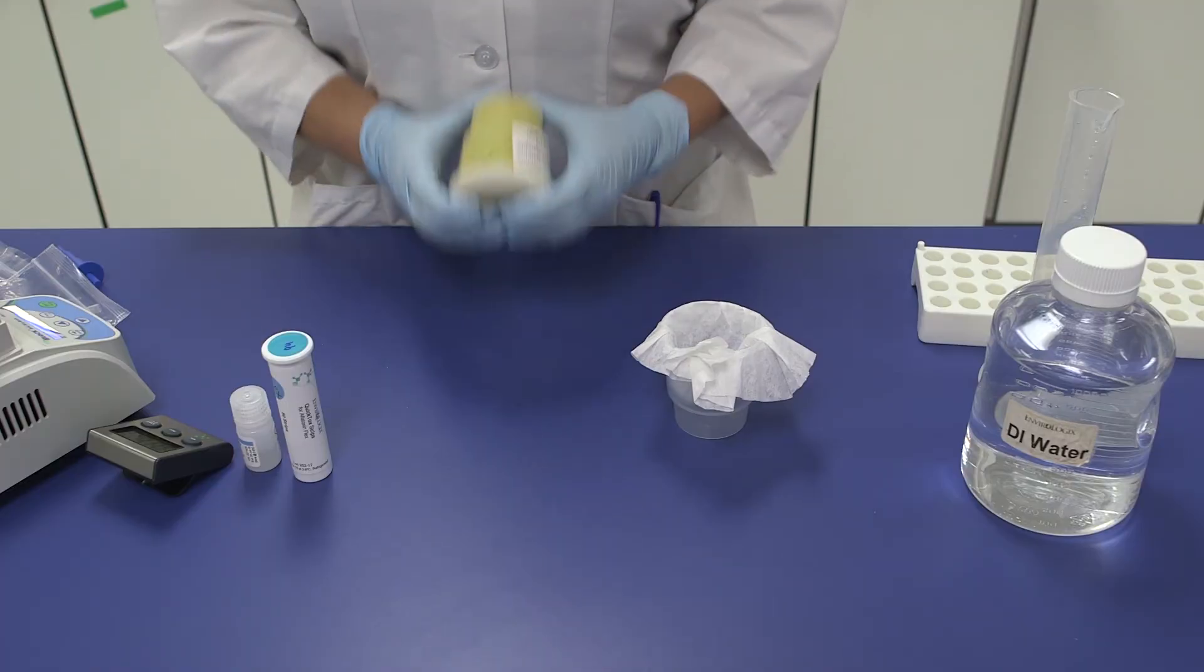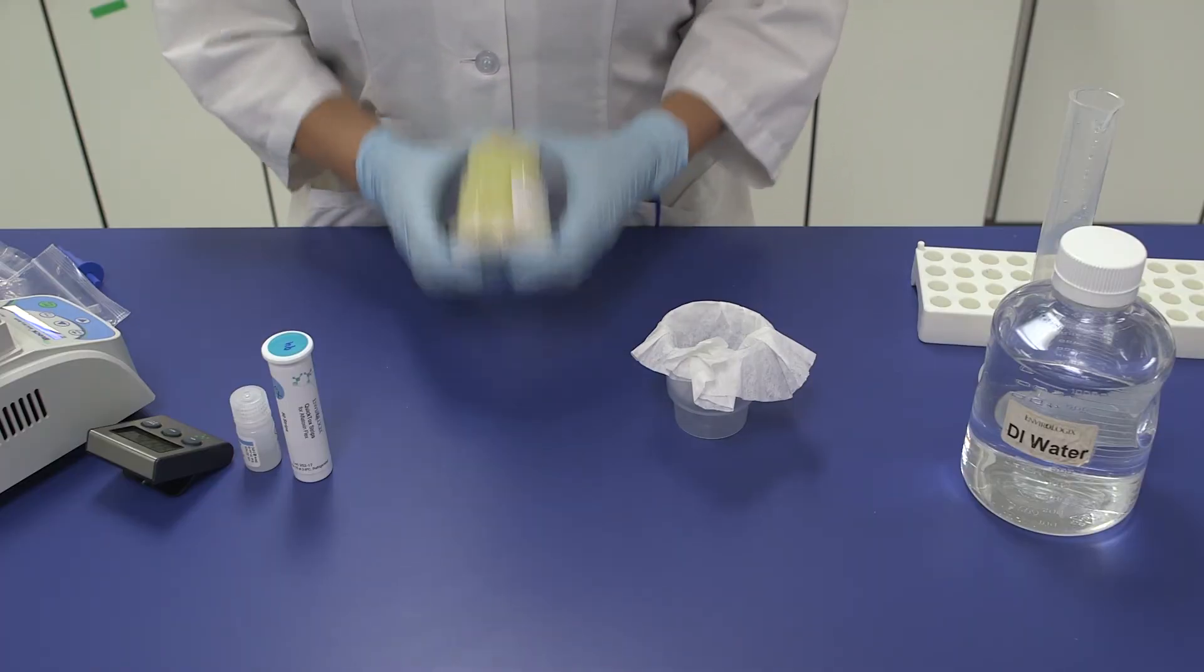This is a critical step to ensure accurate results. Continue to shake vigorously by hand for two minutes, or place the sample cup on a mechanical shaker set to greater than 300 RPM for one minute.